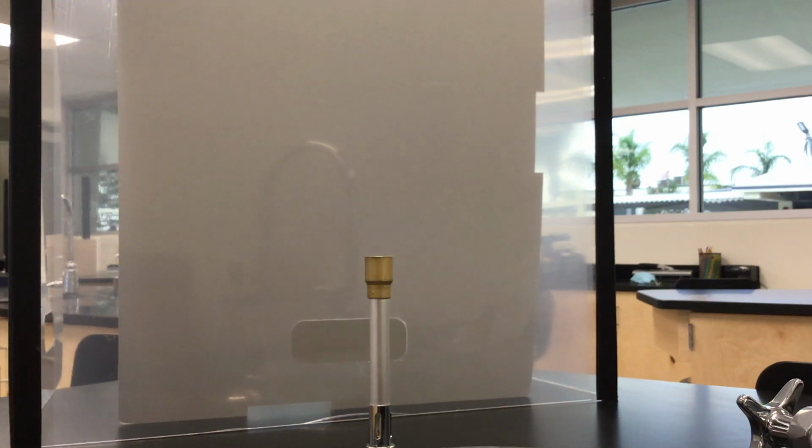All right, perfect. So the lab for today is a flame test lab. Many elements have a characteristic color when burned in a flame, and these unique color patterns can be helpful in identifying the composition of an unknown sample. So I have 7 different unknown samples. Actually, they're known, but we're going to work with those.